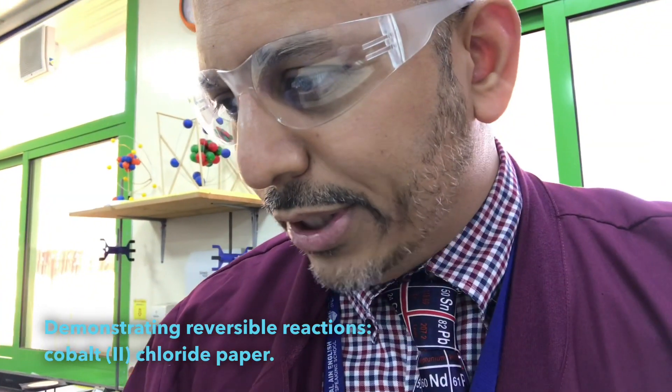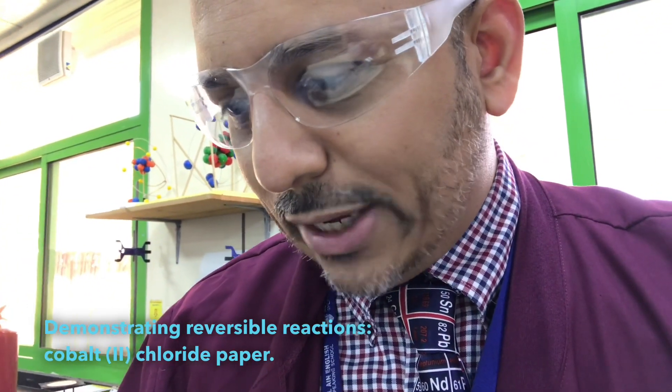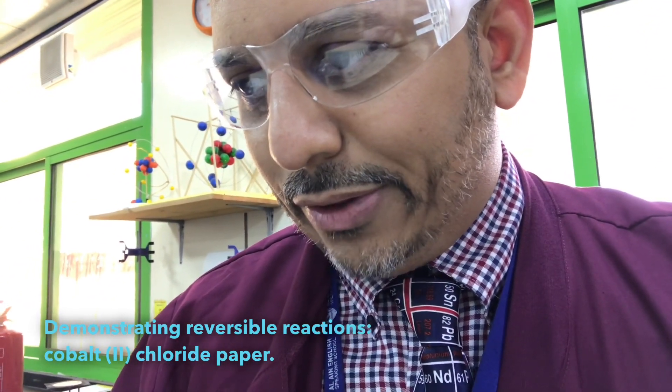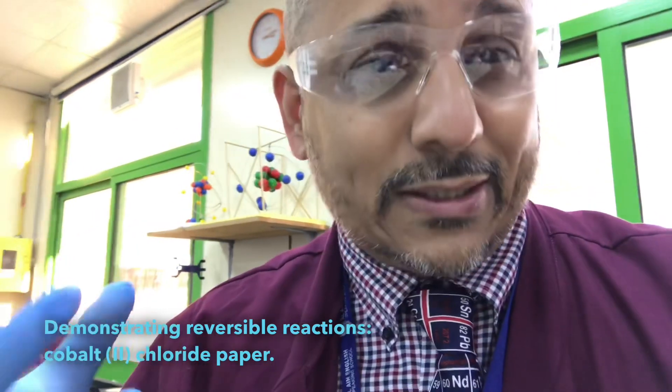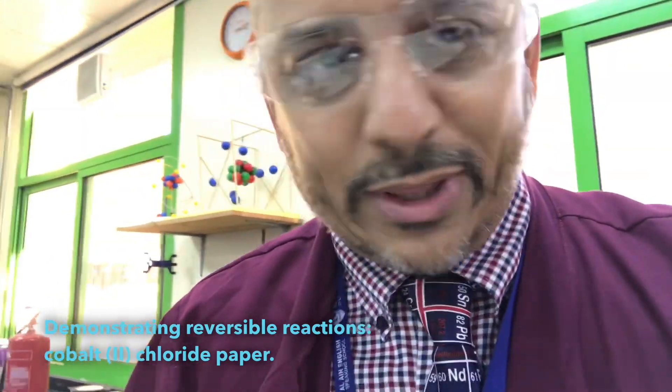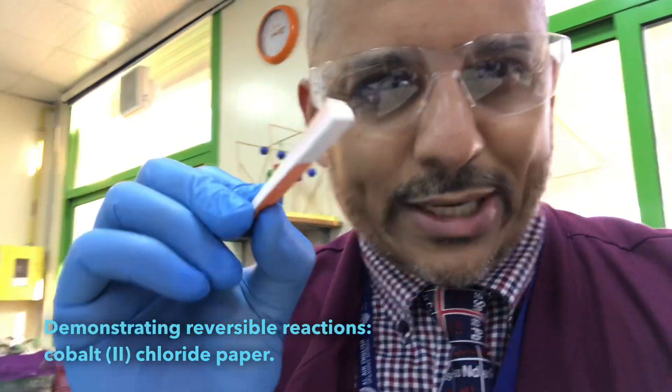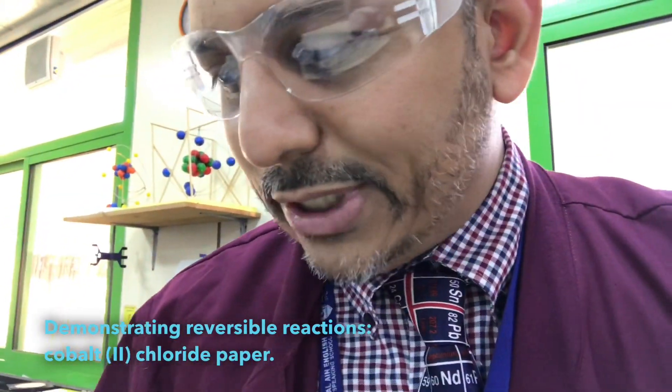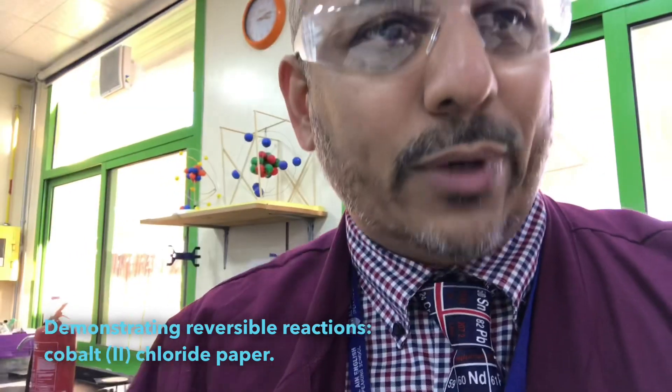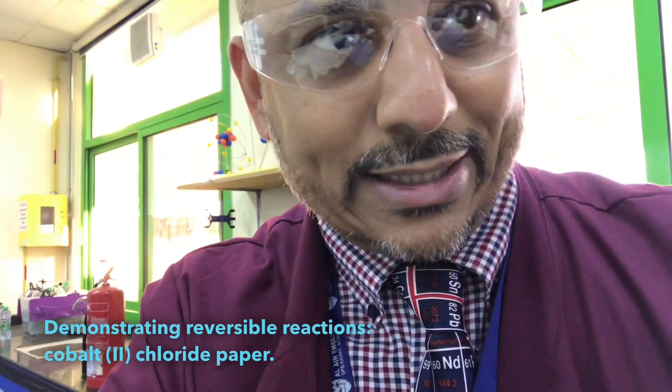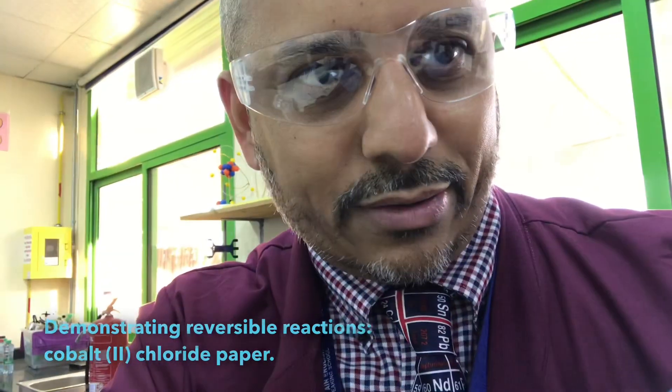To help bring up the blueness of the anhydrous version. Remember, this one is hydrated, but the anhydrous is actually quite a clever one to showcase. In a second, I'll show you.